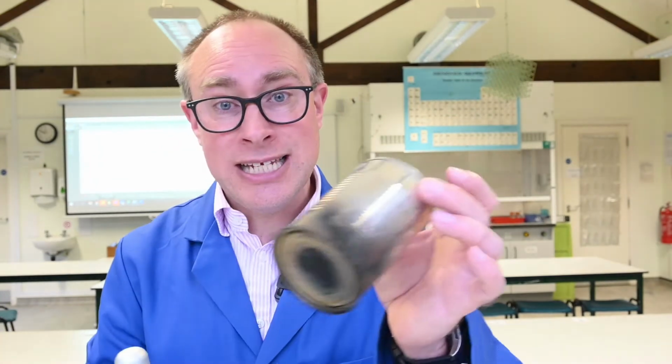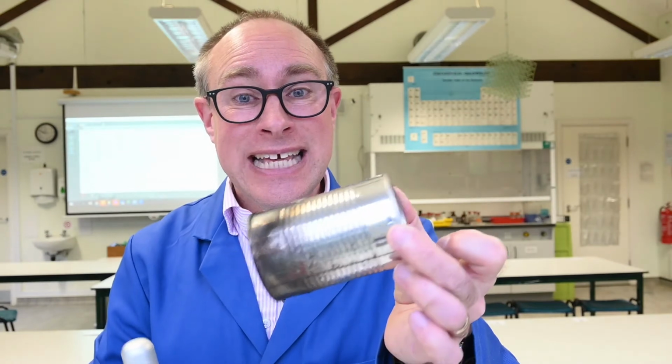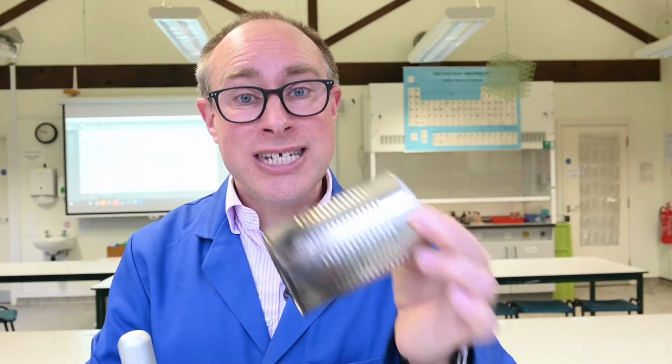And I'm going to heat up the water in a tin can, so I'll measure the temperature of the water rather than the temperature of the flame. The first thing I'm going to do is to weigh the spirit burner before the experiment starts, so that I get a value for the mass of the whole spirit burner with the butanol in it.